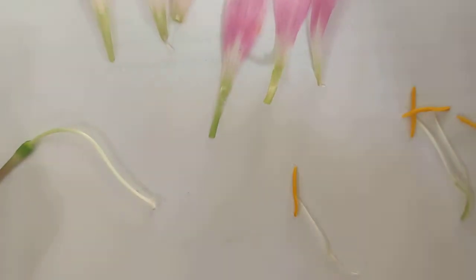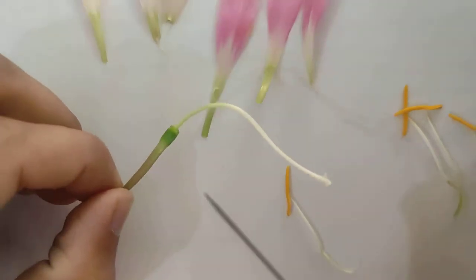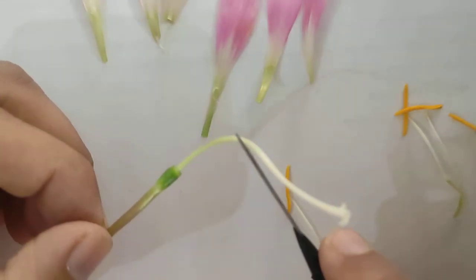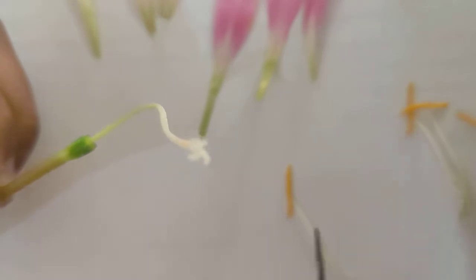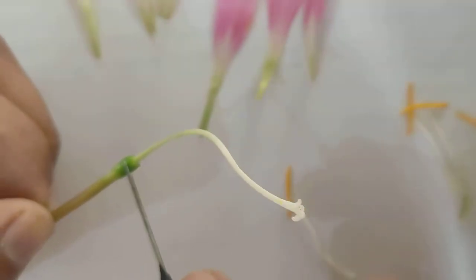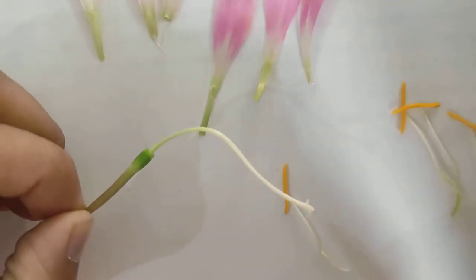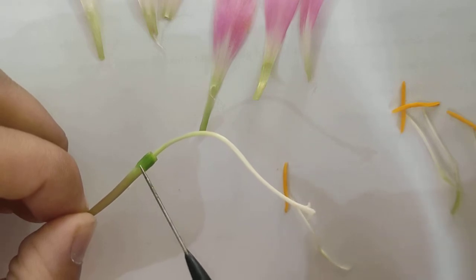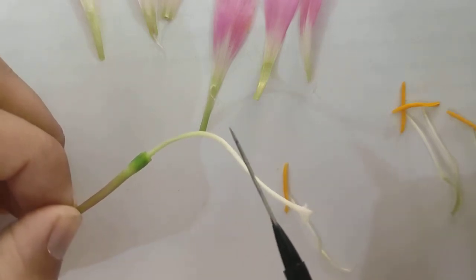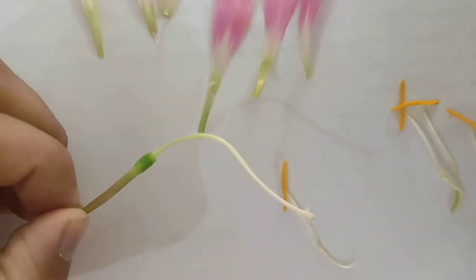Moving to the next part, which is the gynoecium. This is the carpel of this lily flower. The flower is actually a tricarpellary structure — it has three carpels, but these three carpels are joined together; they are fused together. The fused carpel condition in a flower is known as the syncarpous condition.